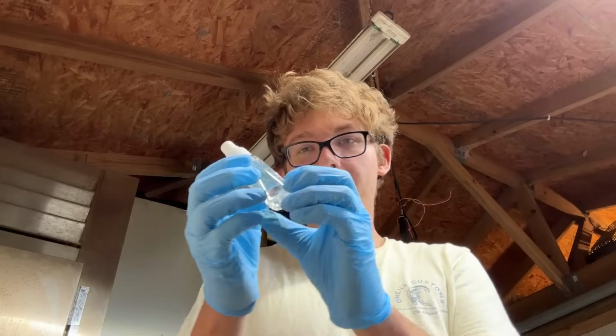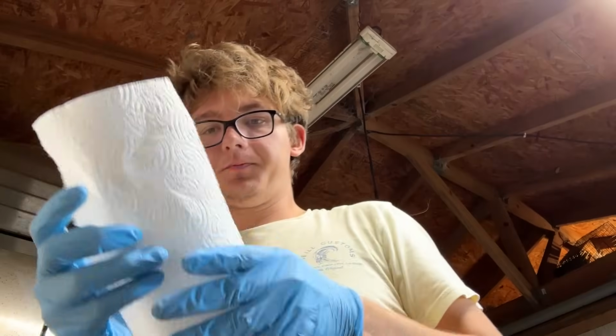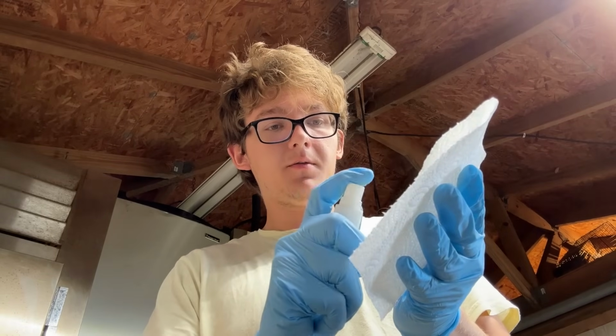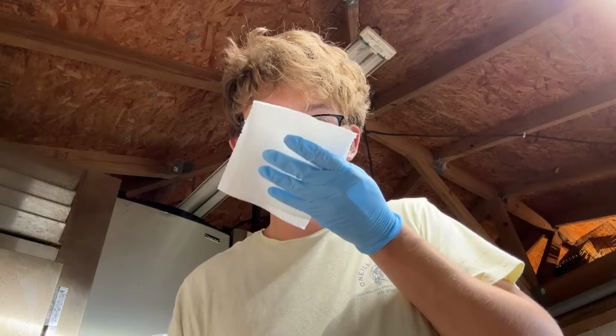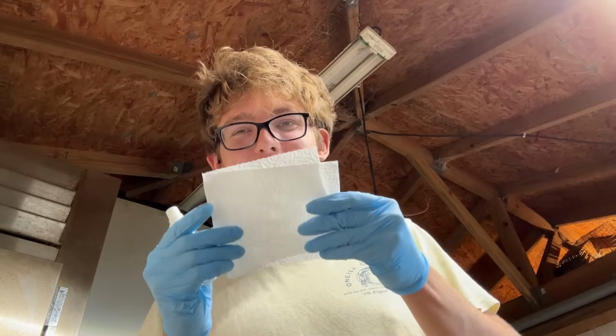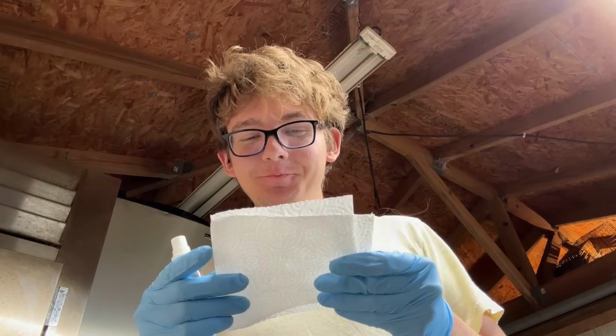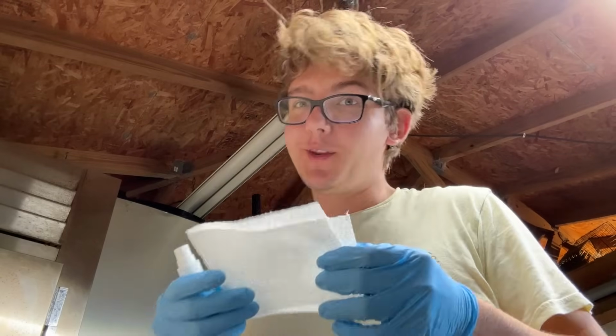Okay, so here is our final stinky feet cologne, perfume. Let me actually grab a paper towel. And I'm going to spray it onto this like you would any perfume or cologne. Spray it on. Yep, it smells like stinky feet. It's a stinky feet cologne. That is amazing. Well, it's amazing because I made it. Otherwise, yeah, you wouldn't want to wear this.